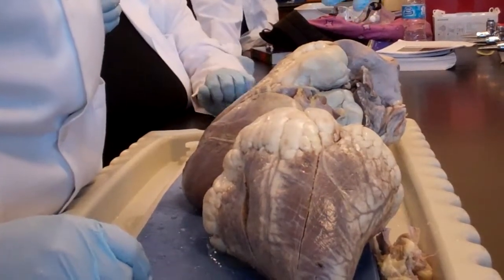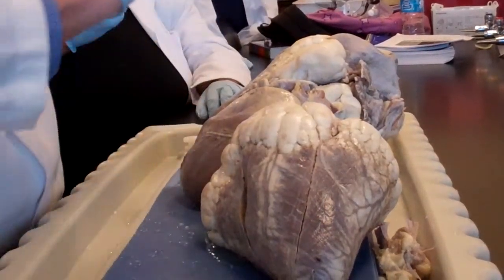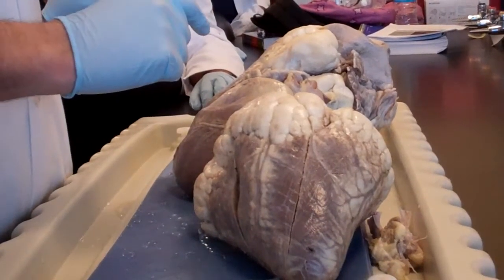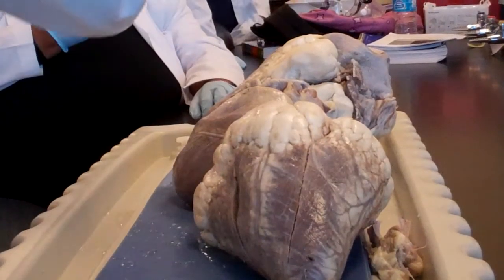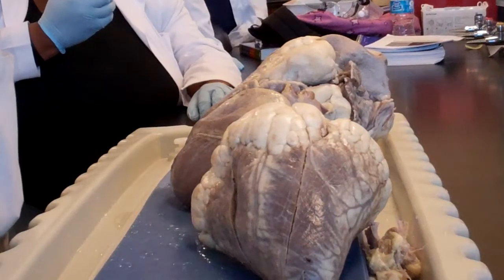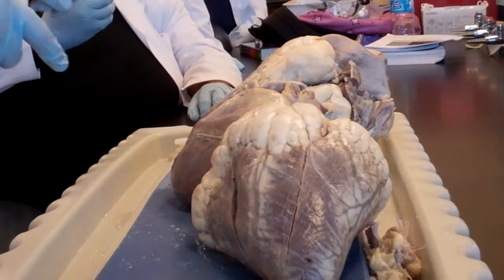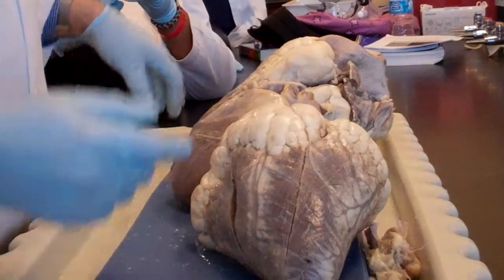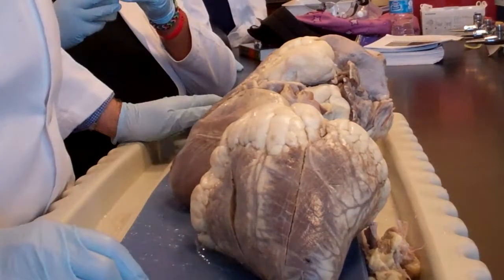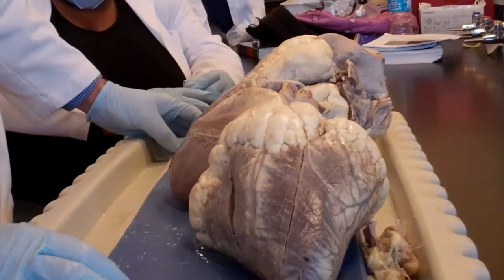And you're going to see the thick thoracic descending aorta after it makes a posterior curve almost, okay? So if this is the anterior surface and you have the C shape, you see the aorta going like this and making a loop, and then it goes all the way back to the vertebral column. You will see that the inferior vena cava will be coming out, but anterior to all those structures. So this will confirm next week.